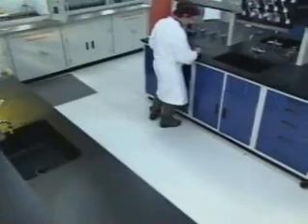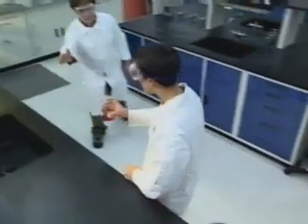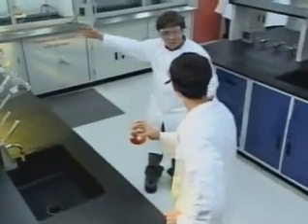Down at the far end of the arena, we seem to have a breakaway. Look at him go. Hold on, he seems to be heading right for the sink. Oh, somebody's got to stop him. Interception. Did you see that? Boy, that could have been a costly penalty, Mia. You never pour chemicals down the sink.